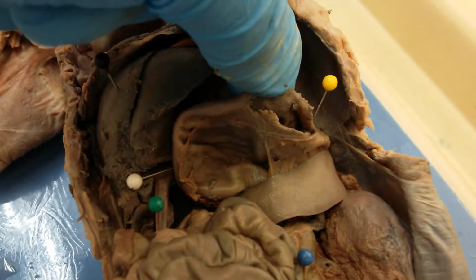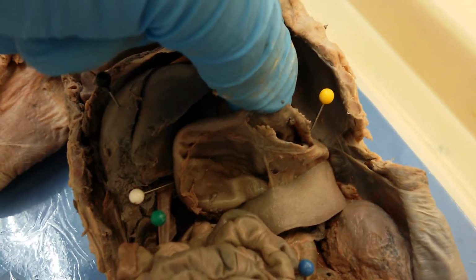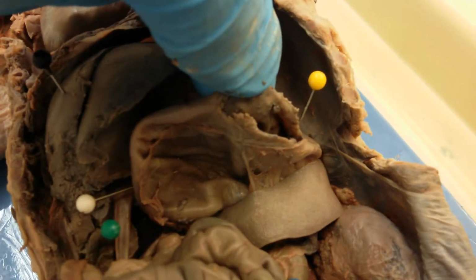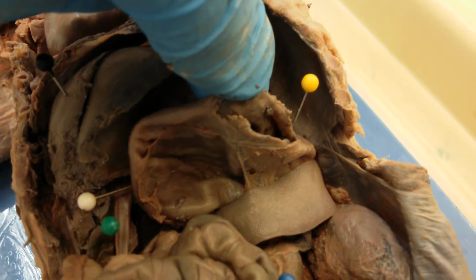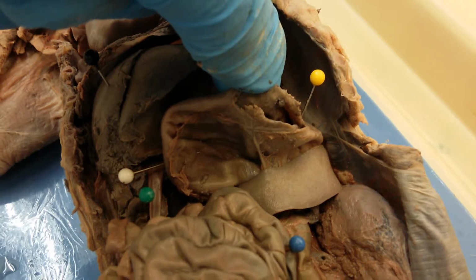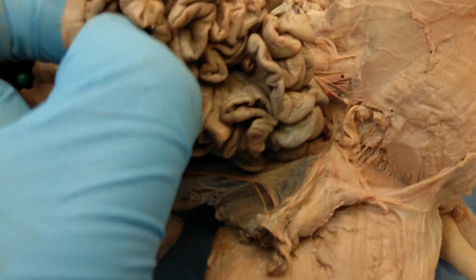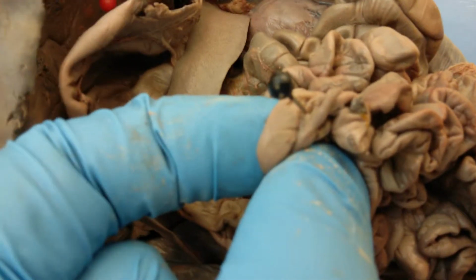And now if you dissect into the stomach, you will see the inside of it is actually rough. So this is called the rugae of the stomach, which help with churning of the food. And then also over here, if you dissect, it's gonna be hard to see without any magnification here, but I'll try.